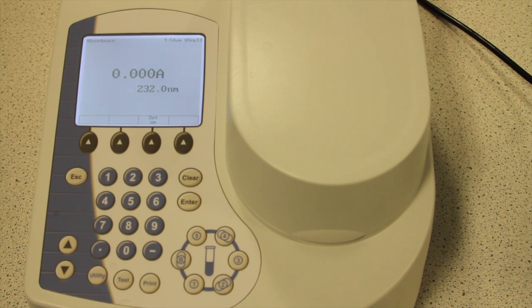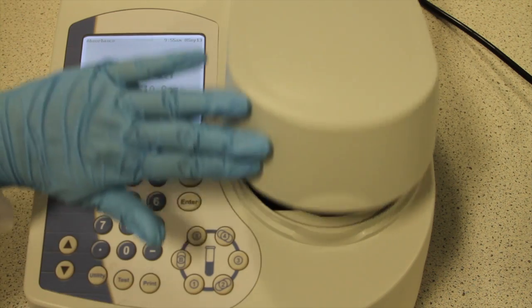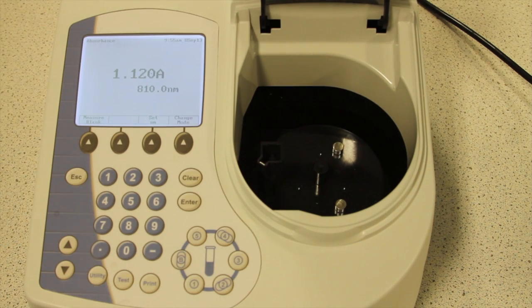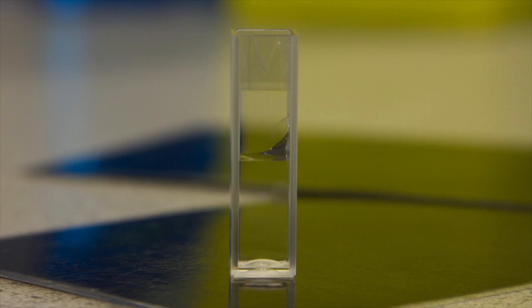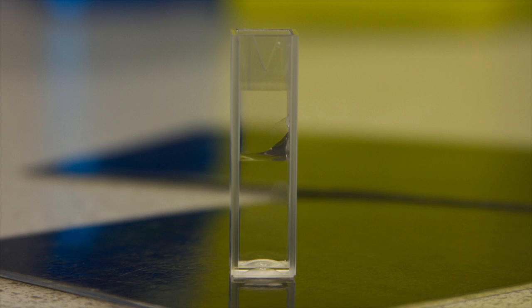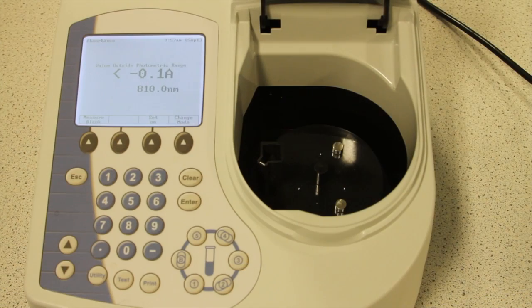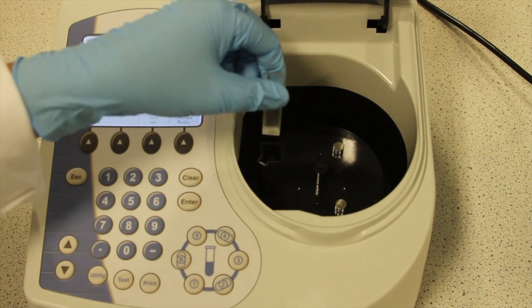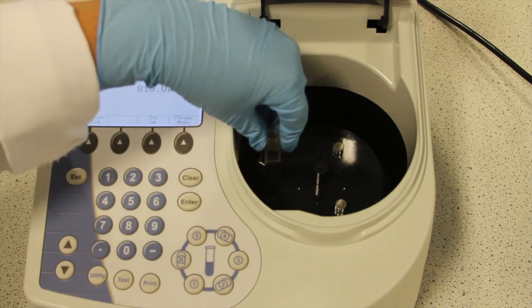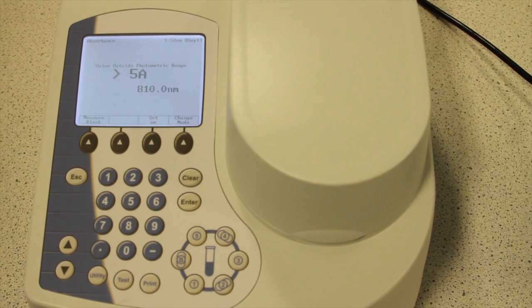It may take a few seconds for the machine to recalibrate. Open the flap on the front of the spectrophotometer and you can see that there is a metal carriage with space for a cuvette. Before taking a measurement of a sample solution, you should always take a blank measurement using a solution of zero concentration. Our copper sulphate solutions were prepared in deionised water, so this cuvette containing only deionised water is the most suitable blank to use. Place the cuvette containing the water into the carriage and ensure that the clear side faces the slit where the light beam will emerge.